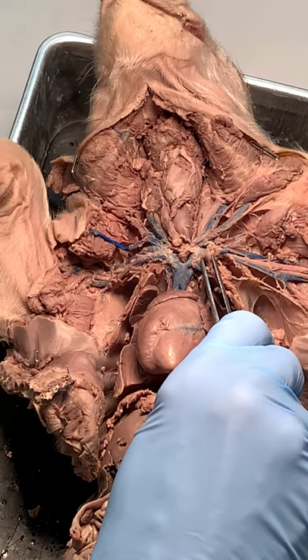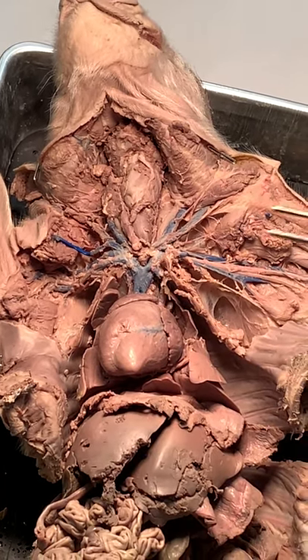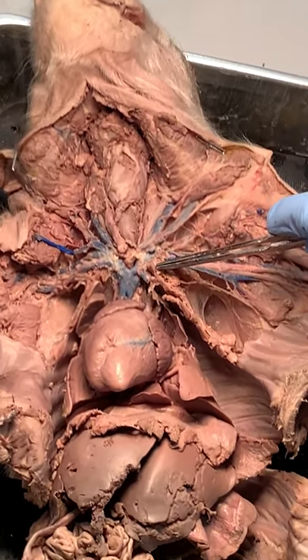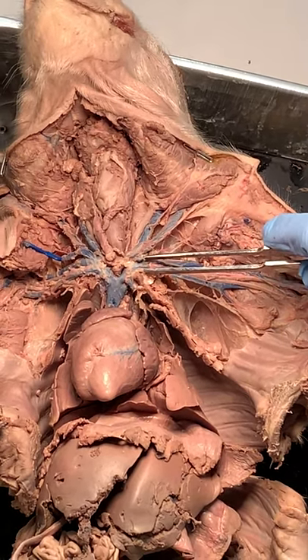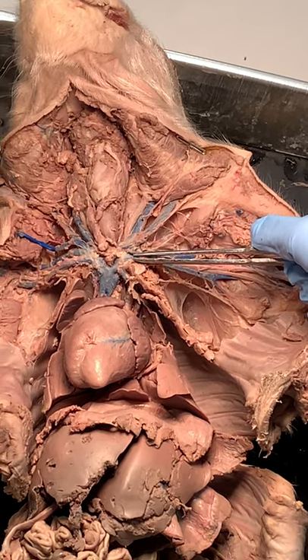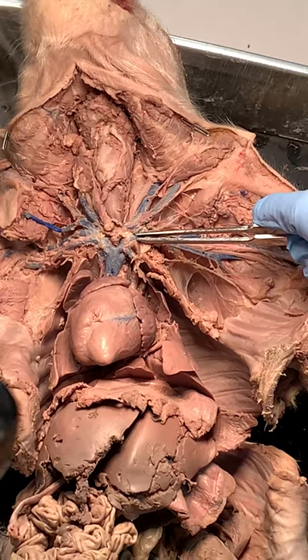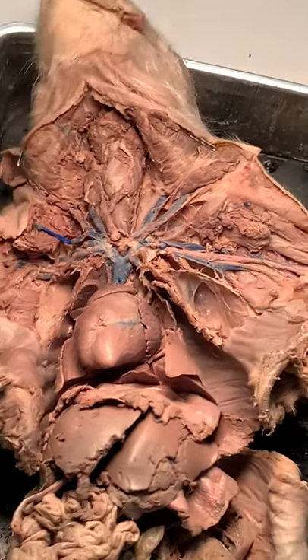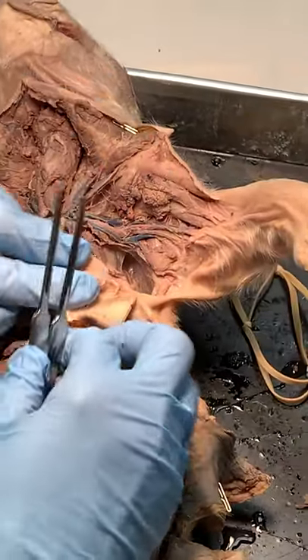This sharp thing here is the clavicle, so anything near it I'm going to call subclavian. The clavicle has been cut away, so let's call this one subclavian.